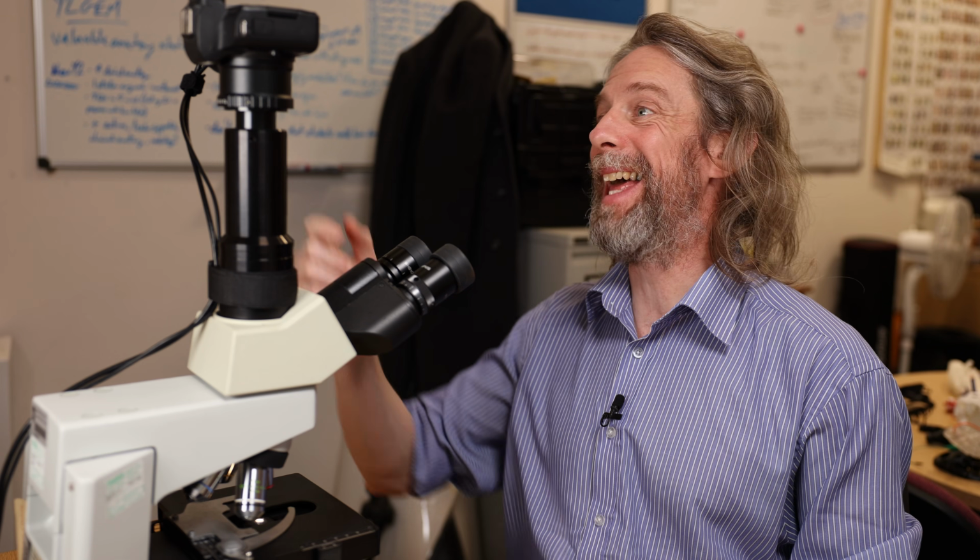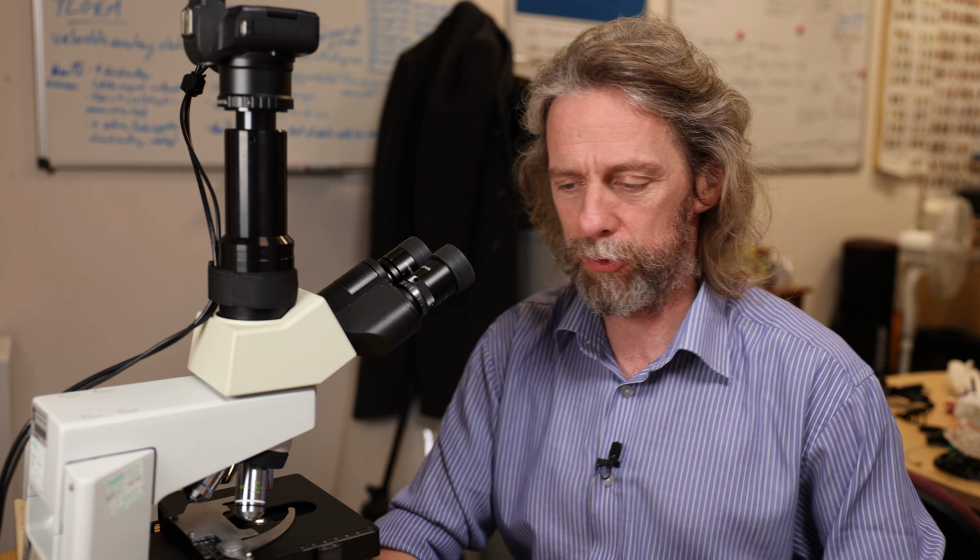Right, some more absolutely classic histology. Skeletal muscle. That is muscle that we can choose to control. Striated muscle, it's also called. Cardiac muscle is also striated.